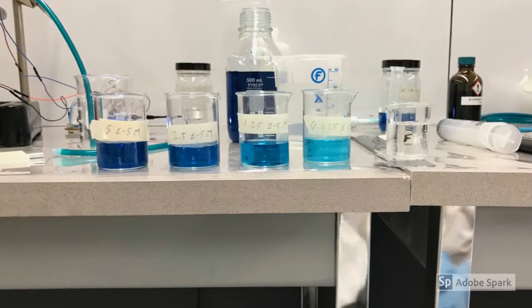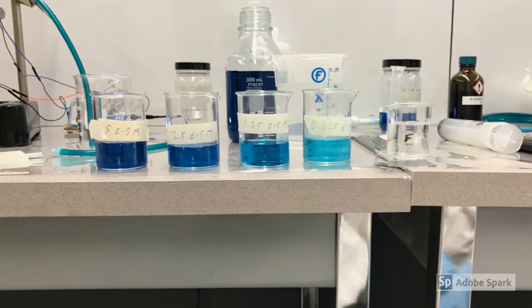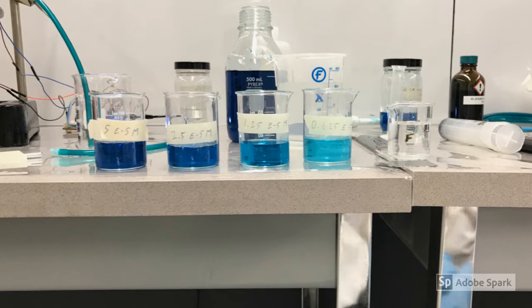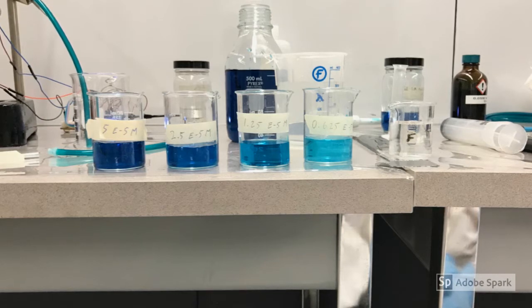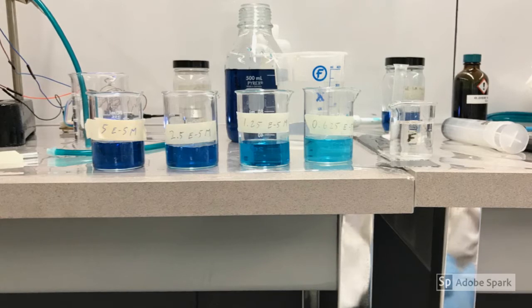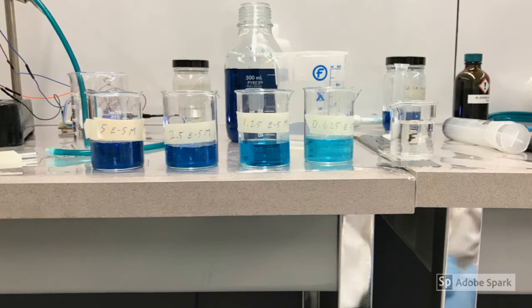At the start of each day of testing, a new calibration curve was made by creating a series of dilutions from the stock malachite green solution and then graphing the transmittance values observed by the spectrophotometer. This allows for the outlet conversion of the malachite green from each of the reactors to be measured by comparing the experimental values to the values on the calibration curve to determine the final concentration of the reactant.